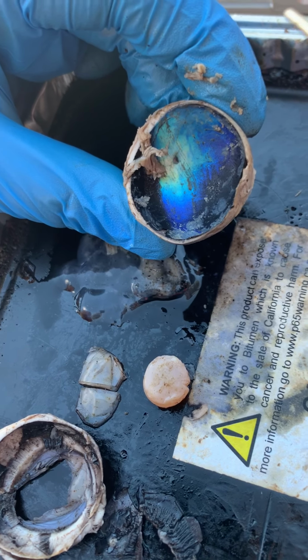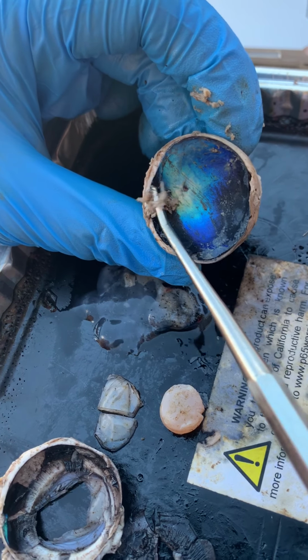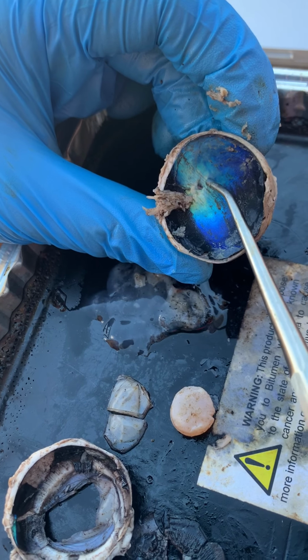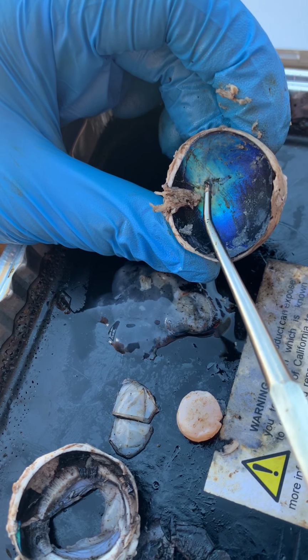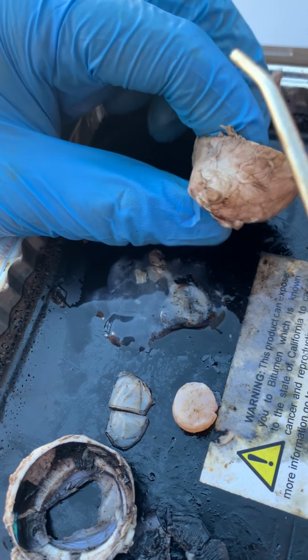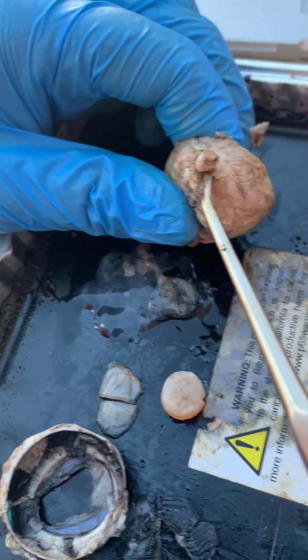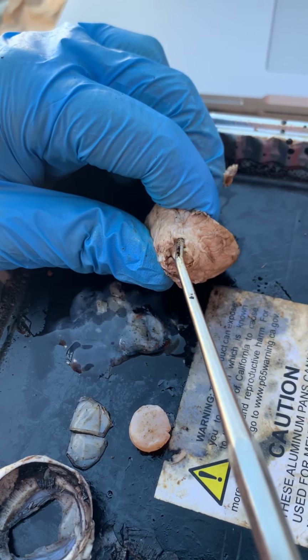This is why we have an area in our vision that we cannot see, and in accommodation, our brain predicts what should be there and tricks you into believing you see something while moving across this blind spot. So finally, we have the optic nerve, which is on the outside of the eye's body there, and that delivers visual stimulus to the brain. This is also called the second cranial nerve.